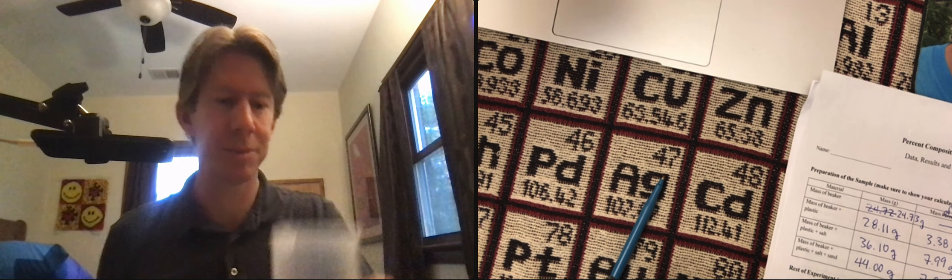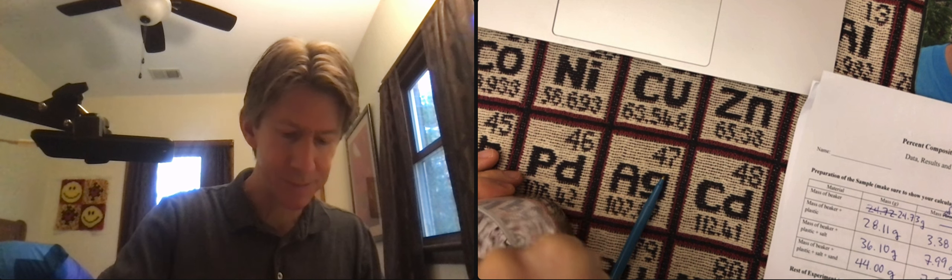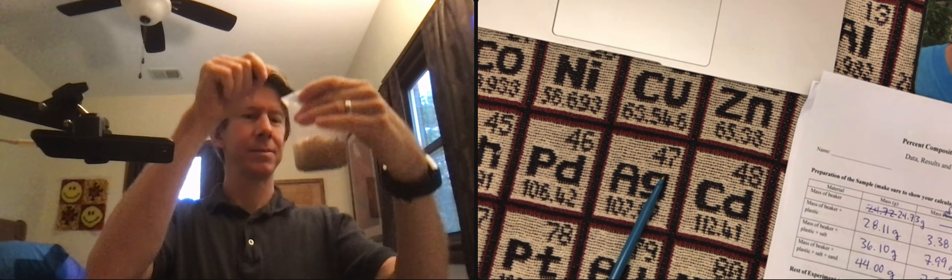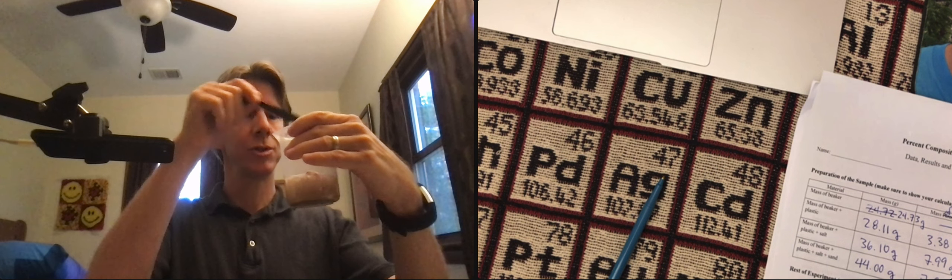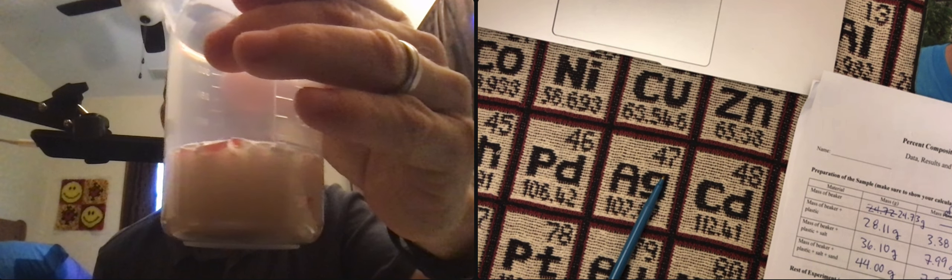You can see, I don't know if you can, that some of the plastic pieces are currently sort of trapped on the bottom. That's what we're going to do. Most of them are floating, but when you mix it, you should be able to get all of the plastic particles to float on the top. So that's why the mixing is important.